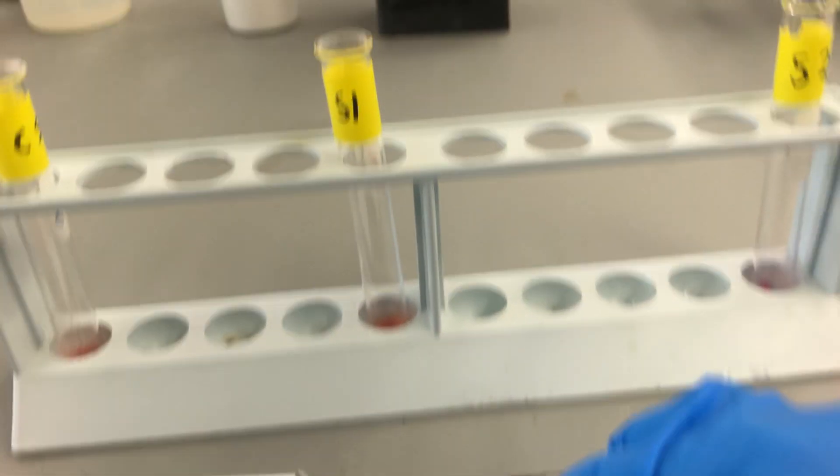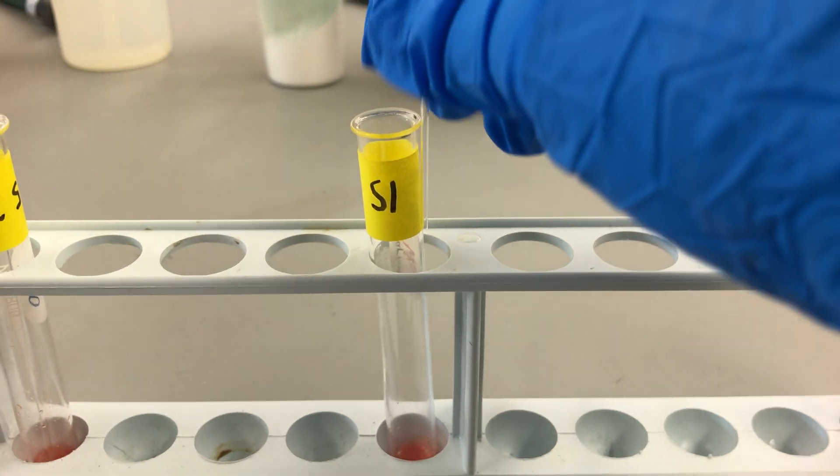Now we want to let it dry completely before we apply any more, and the reason for this is that if we don't let it dry completely, it will spread all over the plate and you won't get good results. So we're going to leave that for now and then we're going to do that with our suspect sample with our second tube.